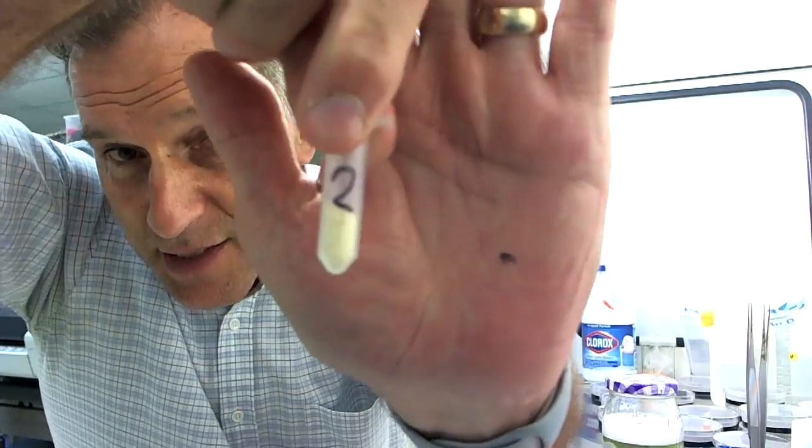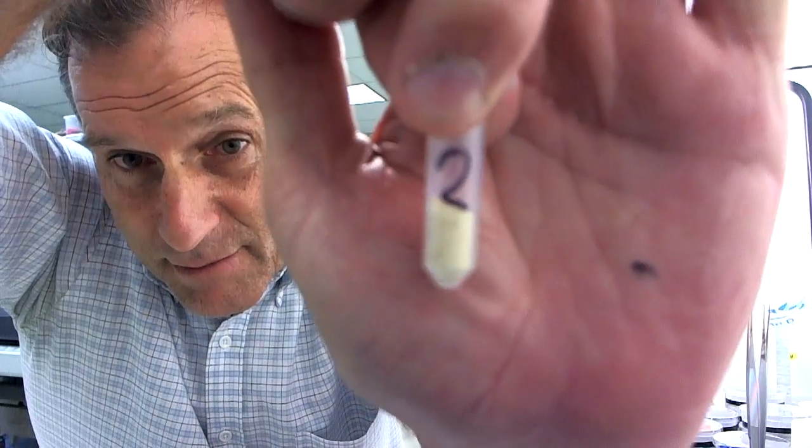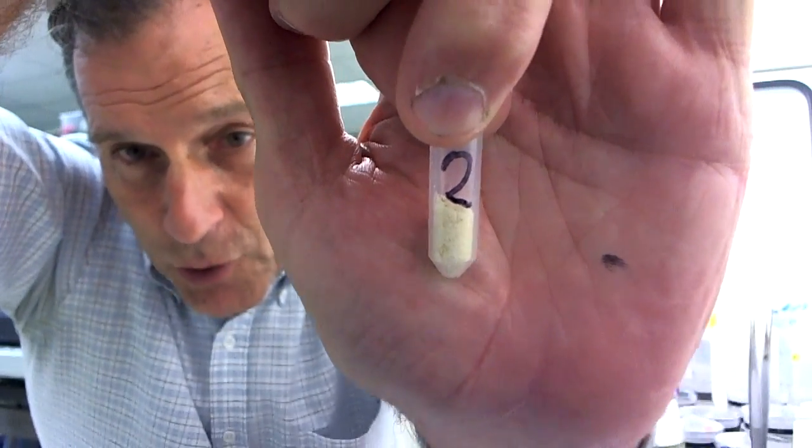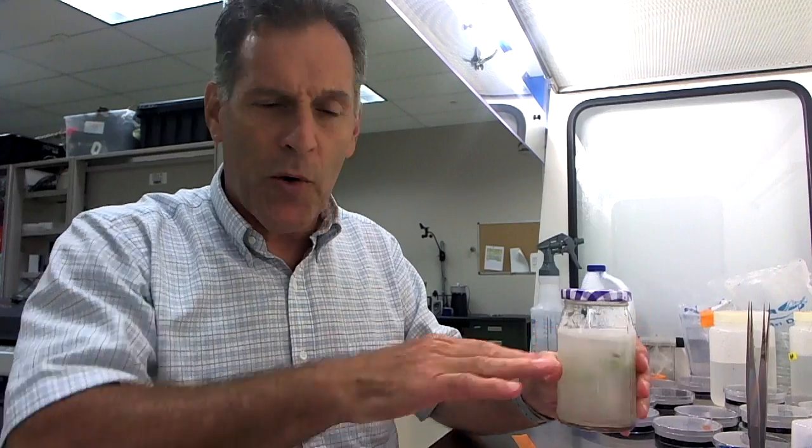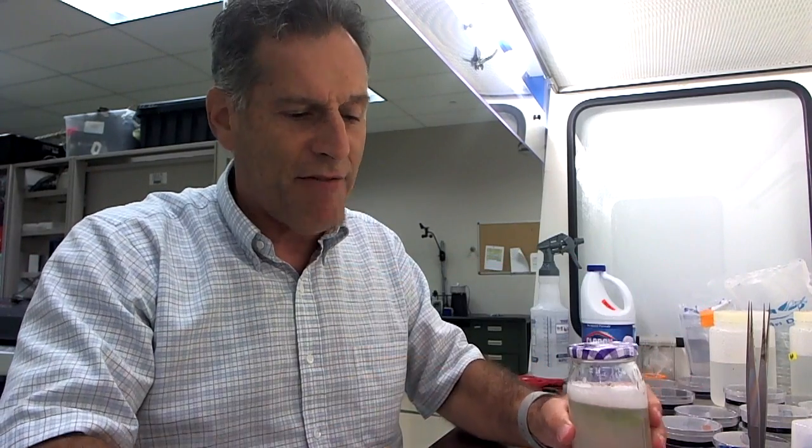The seeds are a little bit different. I should show you the seeds that I have. The seeds are from, this is a Cypripedium, and this is what the seeds look like. They're just tiny dust-like things in this tube. The seeds, because they're so small, they're a little more sensitive to the bleach, so instead of 50%, I'm supposed to use 5 to 10%. I'm going to use 10% bleach, but then it's the same type of thing. You rinse with sterile water. I'm shaking because it's good to shake every few minutes. At the end, I'll show you how to plate the seeds. We've got about 20 minutes, and then we'll rinse this and go. See you in 20 minutes.